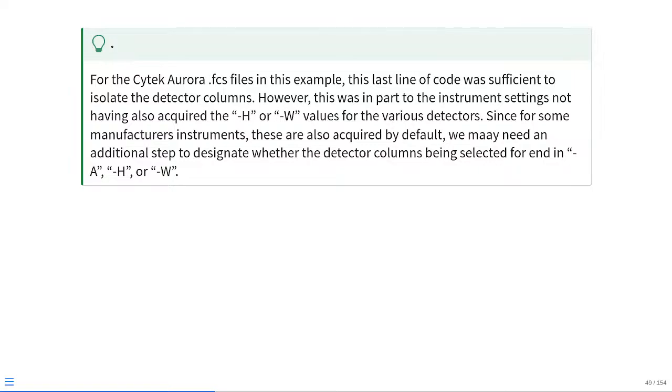So in this case, if we want to be using our signatures based on the area parameter, we would want to be excluding the hyphen height or hyphen H, the hyphen width or the hyphen W, but keep anything that ends in hyphen area, i.e. hyphen A.